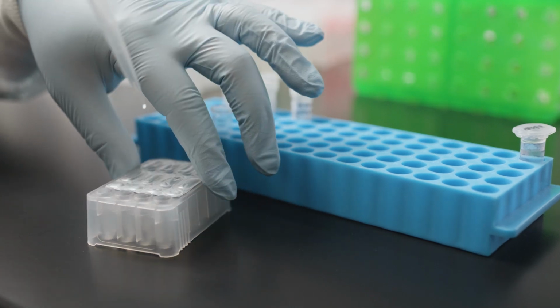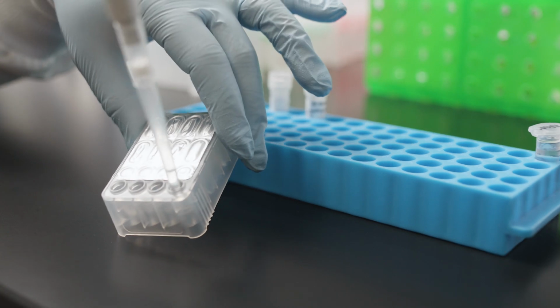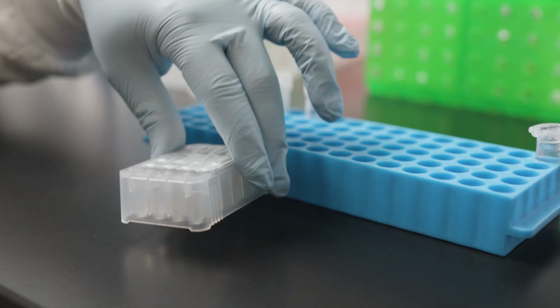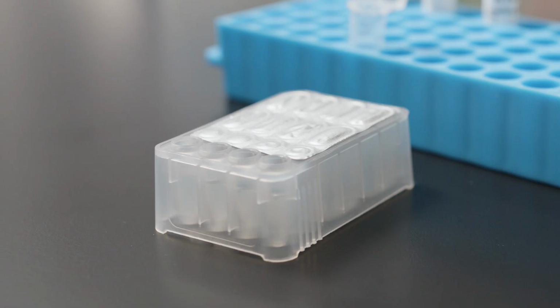Once all the libraries are in the sample cartridge, gently tap the cartridge on the bench surface to remove any bubbles, taking care to not splash liquid, as this can lead to lane-to-lane contamination. The sample cartridge is now ready to load in the instrument.